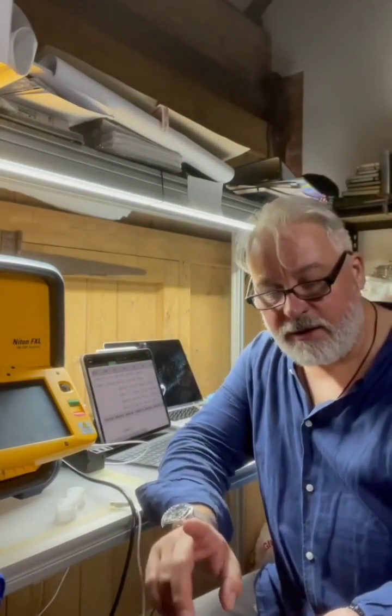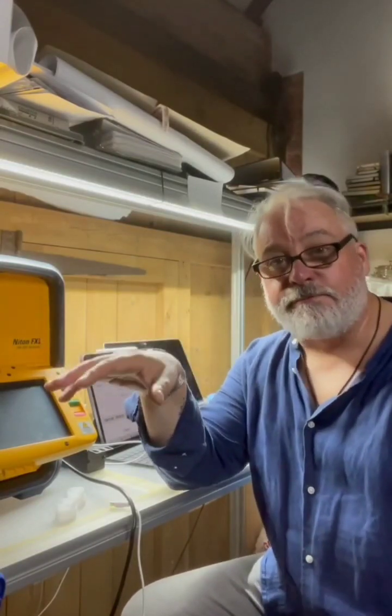I've literally got everything that I did. All samples, by the way, are tested 4 times, and then they're averaged out, and we take a mean from that. So we do the same sample 4 times under each setting, and then we take the average of those. So that's what I've done. So I'm giving you the average rather than the individual readings.